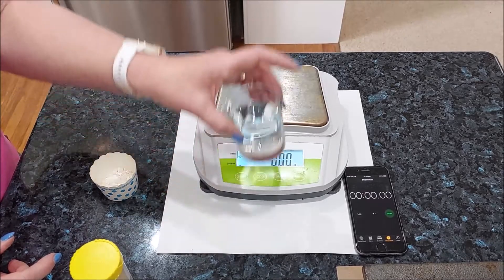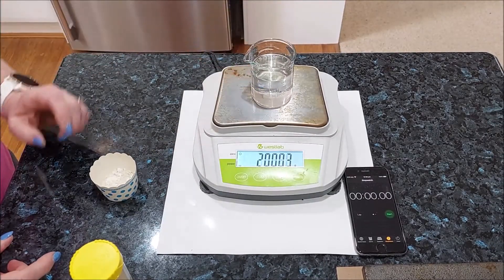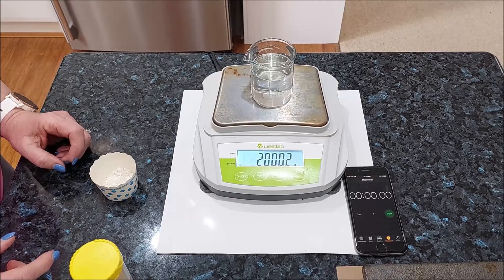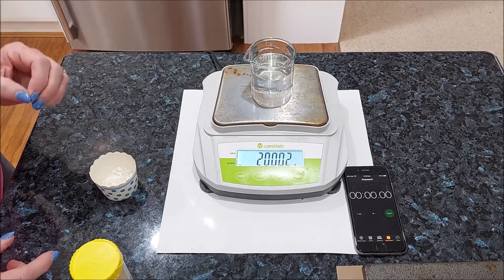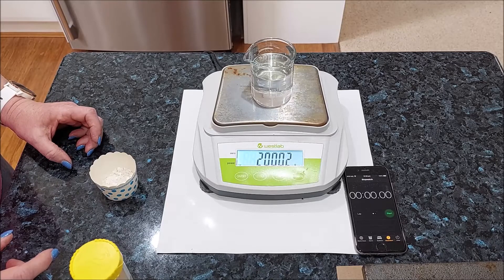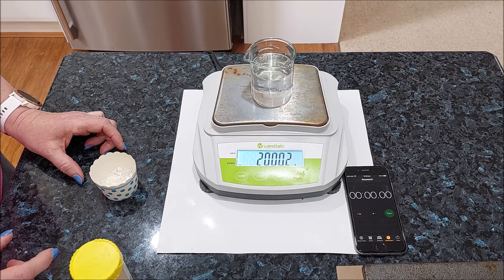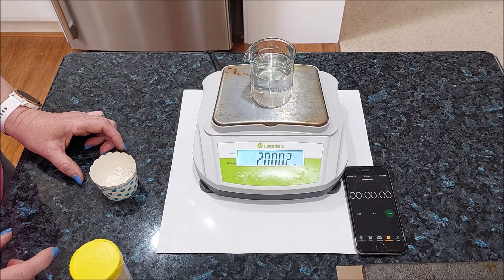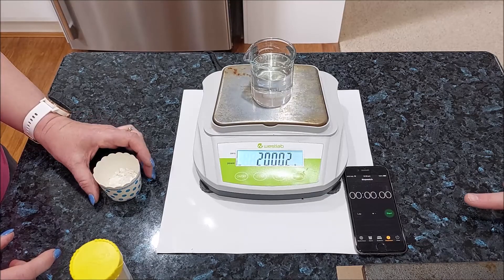I'm going to put my acid on the balance and my start weight is going to be that plus the mass of my marble chips, so don't forget to add that in. I'm going to tip the marble chips in and start the timer and we're just going to watch and see what happens.